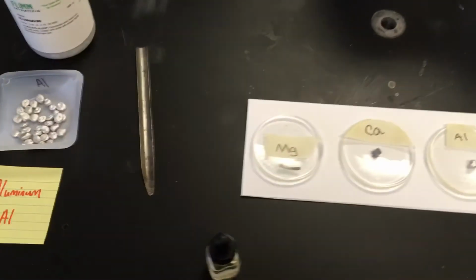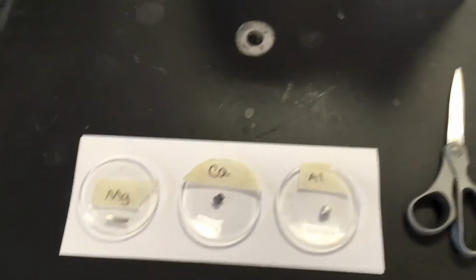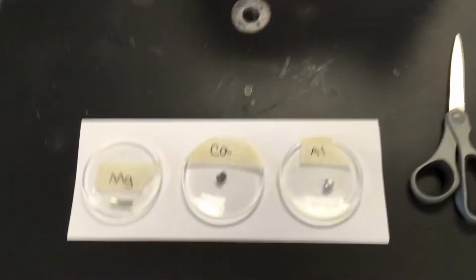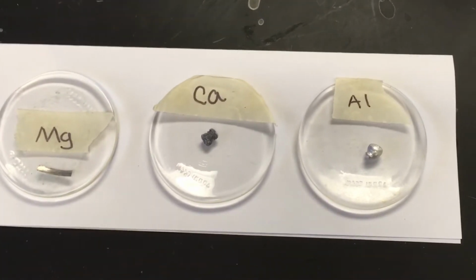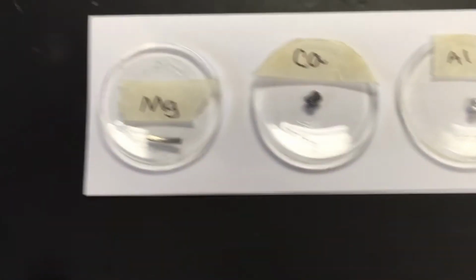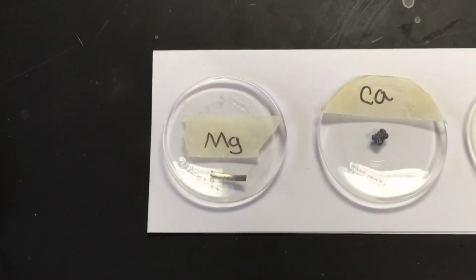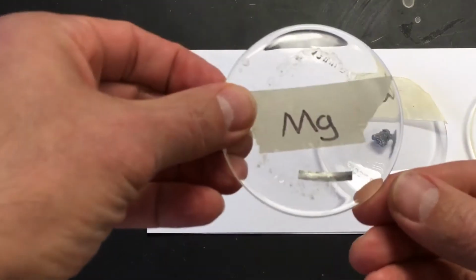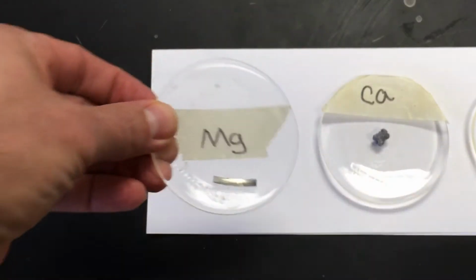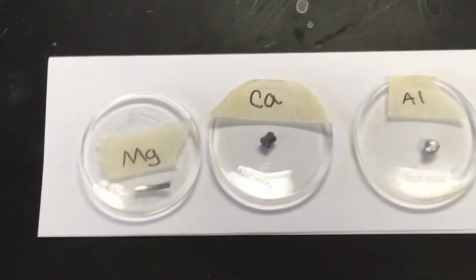And I'm going to slide on over here. So here's a great photo opportunity, and let me shift it down a little bit. And I'll come on over here to magnesium. And once it stops shaking, there we go. Take a photo right now of magnesium, and I'll even hold that up. But you don't want to see my hands in your photos, so let's just leave it like that. And here's a picture of calcium.